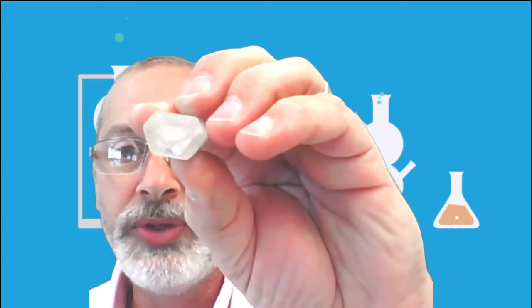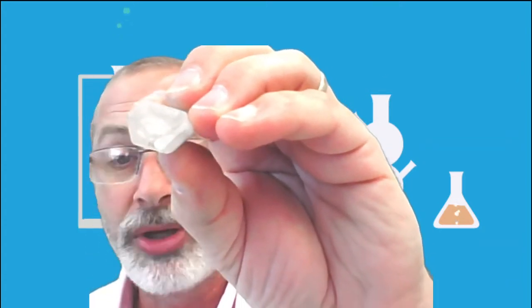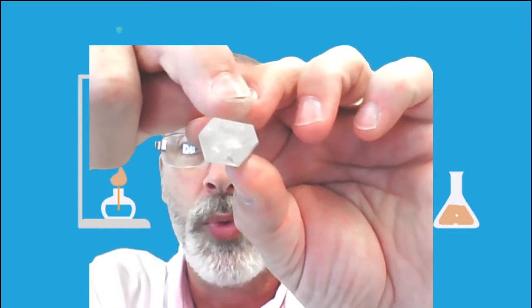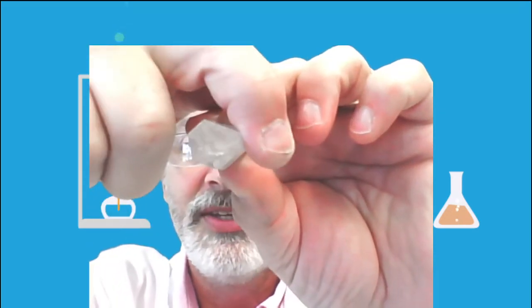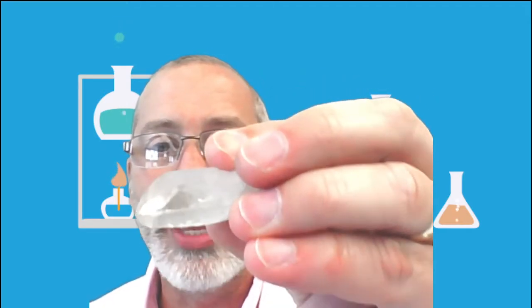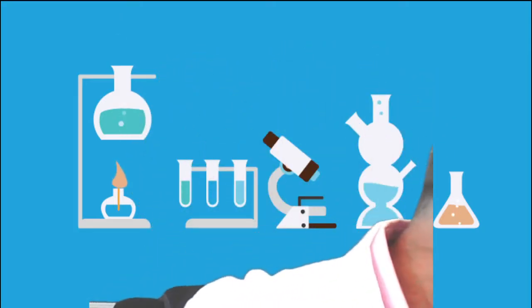And I'm going to hold it so that you can see its cross section here, because the hint for mineral number 6 is its crystal shape. Take notice of its crystal shape. 1, 2, 3, 4, 5, 6 sides. This has a hexagonal crystal shape, and that is a really big hint for this mineral. That was mineral number 6.